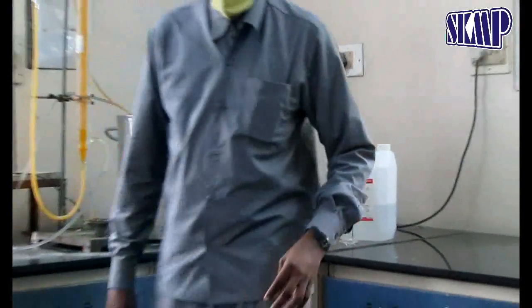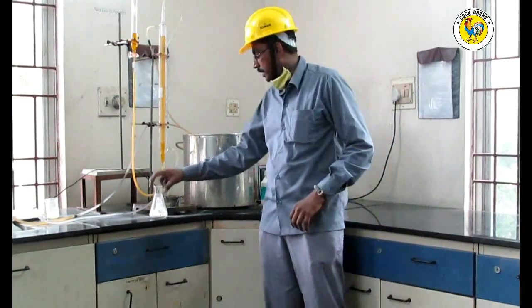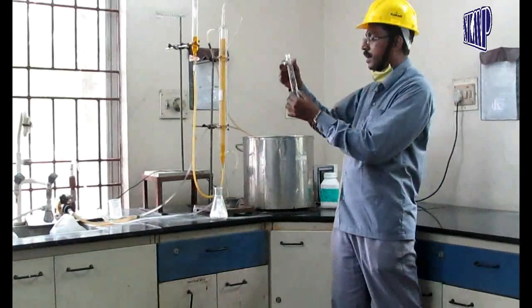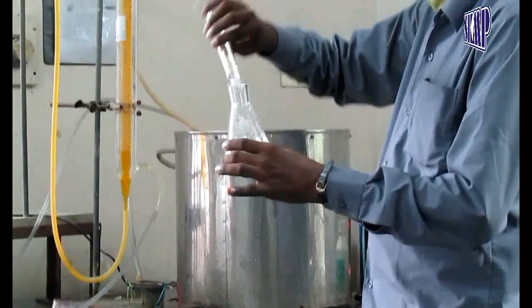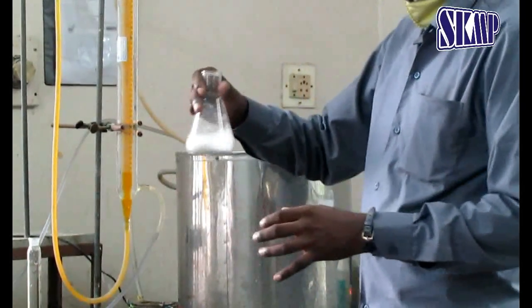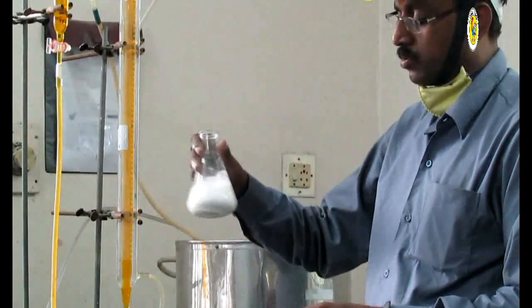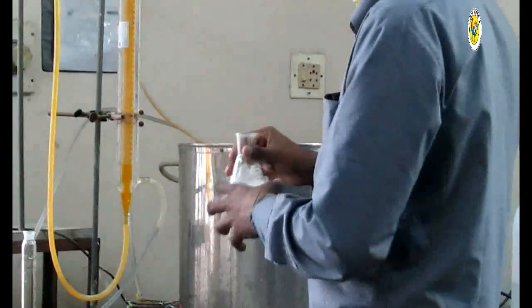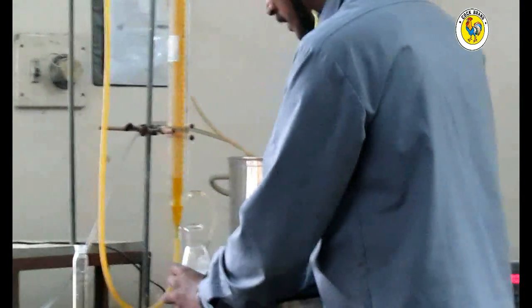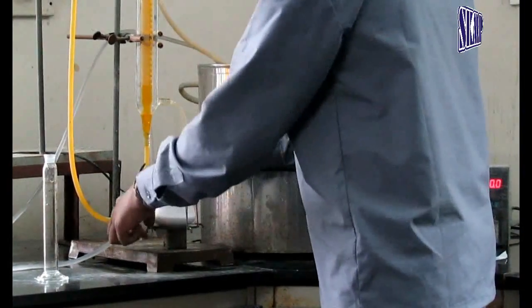First, we take 12g of calcium hydroxide in a 250ml conical flask and then add 40ml of DM water. Mix well to get a homogeneous solution. Then it is kept in a water bath for 5 minutes before testing is carried out.